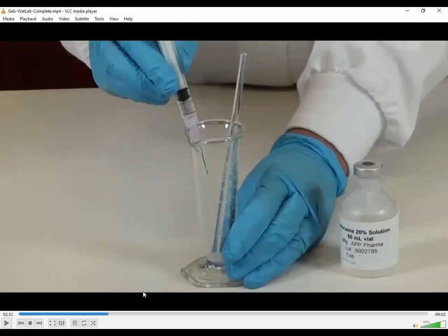You're then going to use a glass stir rod and stir, stir, stir, and dissolve that acyclovir within that 1 milliliter of lidocaine. Now, it doesn't go in solution right away. It takes some time, and it really takes time if you don't grind it up first. So grind it up first, put it in there, mix it with the 1 mil lidocaine, and give it a little bit, and it will start to dissolve. While it is dissolving, you're going to stop, let it sit for a little bit, and go prepare your lips and your pluronic. So realize you want to get this step started and then go get your lips and pluronic.